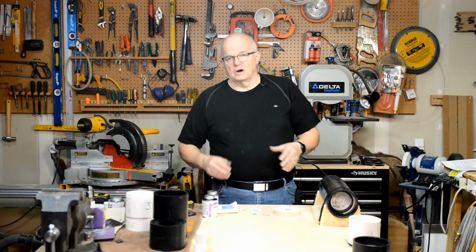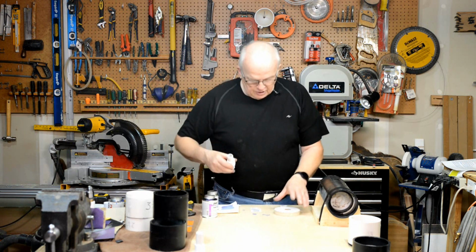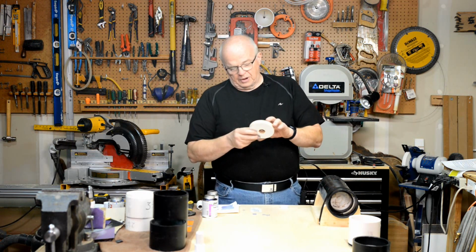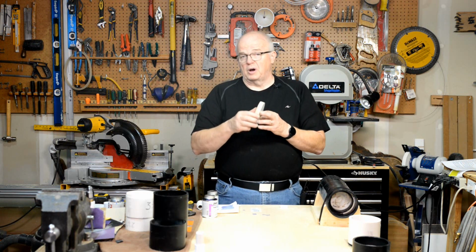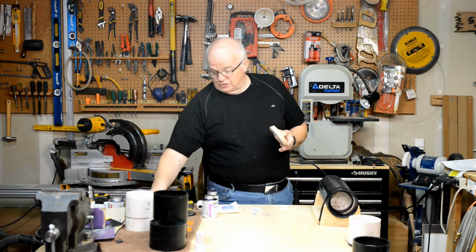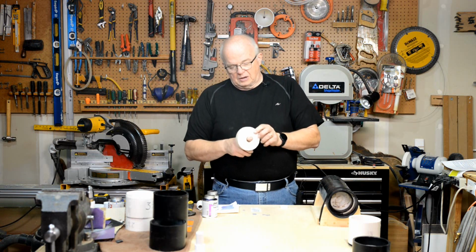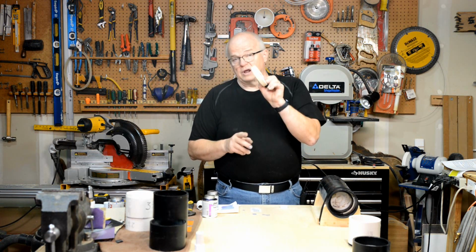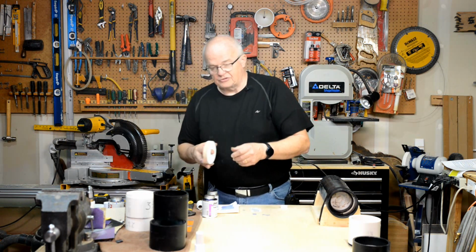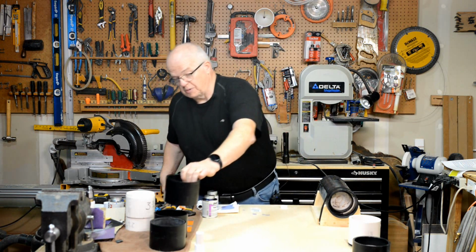Okay, now that that's done, we're going to apply our first piece of PVC into our acrylic plate. Now, this is the acrylic plate that you've made. Now, I'm using wood. I'm reminding you that I'm using wood here because I don't have another piece of this acrylic. I used it all up while I was engineering all of this. So, because this is just for demonstration purposes, I went ahead and used a piece of wood in place of the acrylic. But if you'll notice, this piece still fit in there quite nicely without any problem.